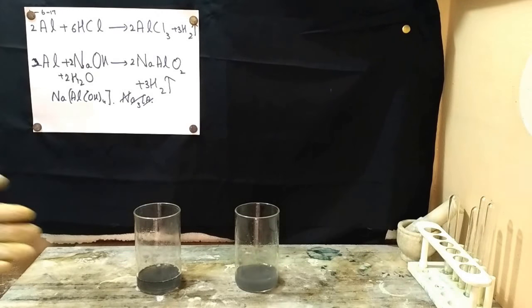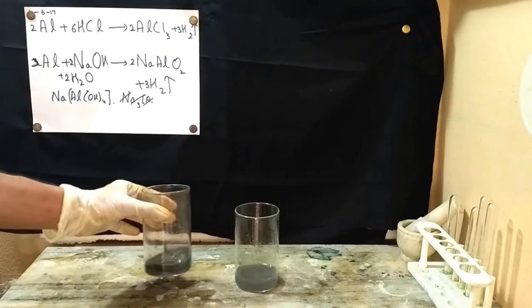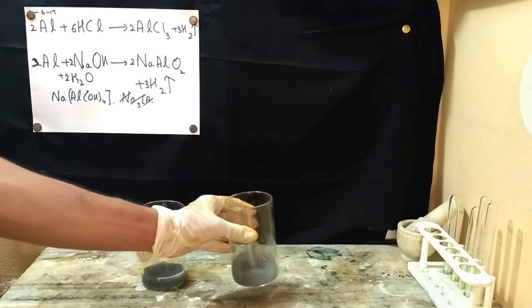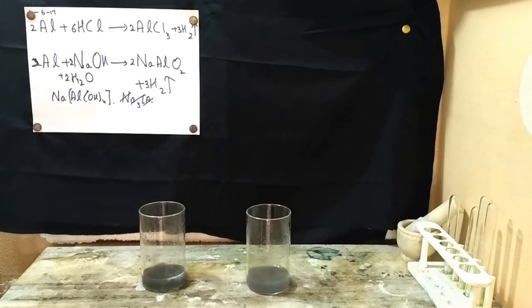As you guys had seen, with hydrochloric acid the reaction was almost instantaneous, but with sodium hydroxide it took some time. And that's all from my side in this video.